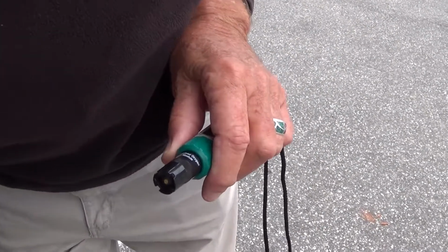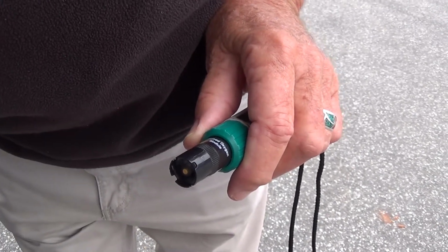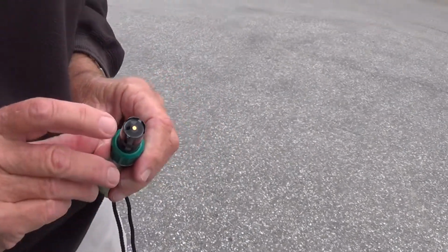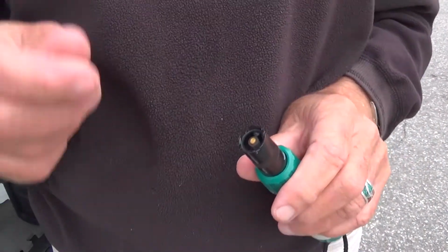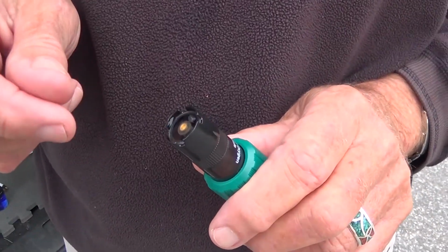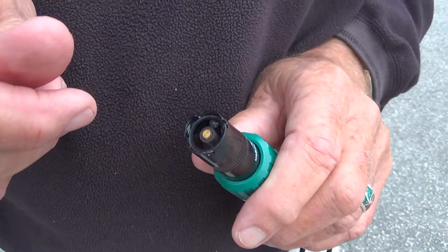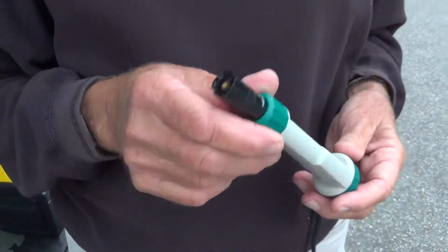I'm going to put these caps on. Last thing I want to do is spill this. Okay, this is the membrane. And it says in the directions to inspect this for any tears, and maybe, more importantly, bubbles. So let's talk a little bit about bubbles. If you have those present, you'll get an erroneous reading.